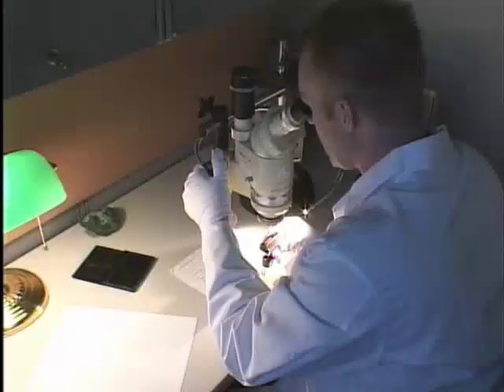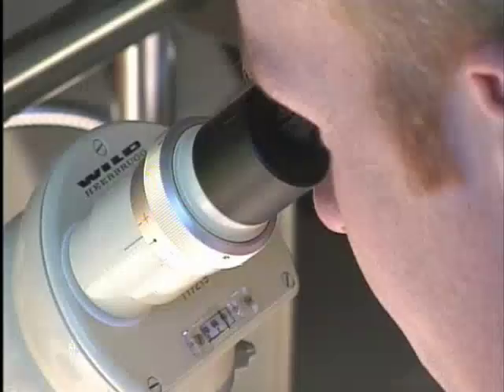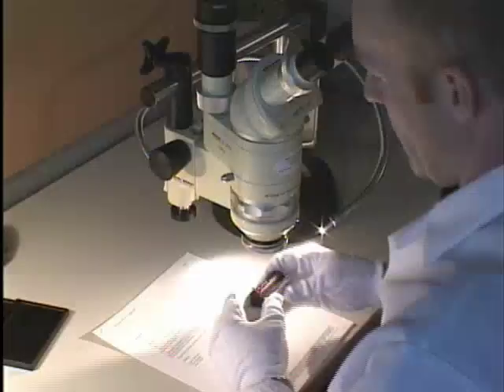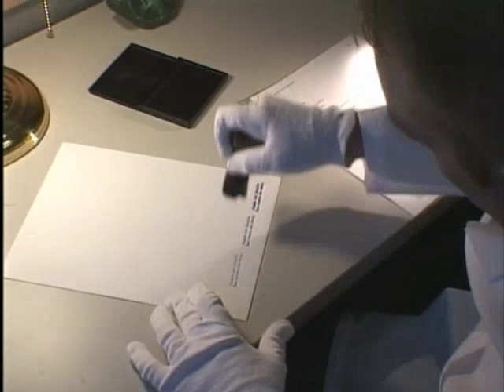All manufactured mechanical devices contain microscopic irregularities such as dents, pits, or scars. Using a stereo microscope, the examiner locates the unique markings on a mechanical device such as a typewriter, check protector, notary seal, or rubber stamp. When the unique markings on the device match impressions of those markings on a questioned document, a key piece of evidence is established to help the law enforcement investigator build the case.